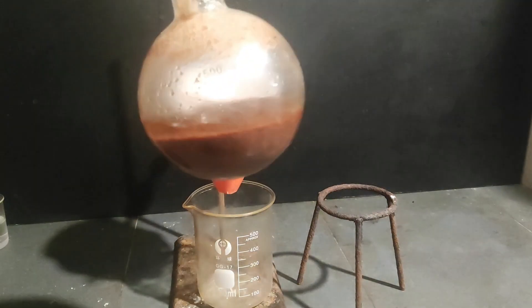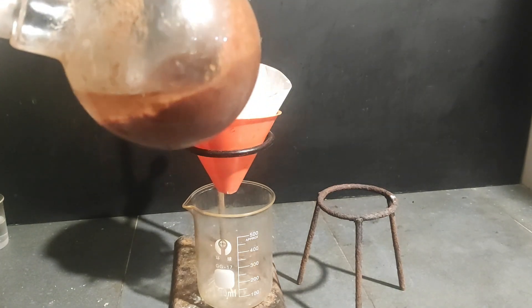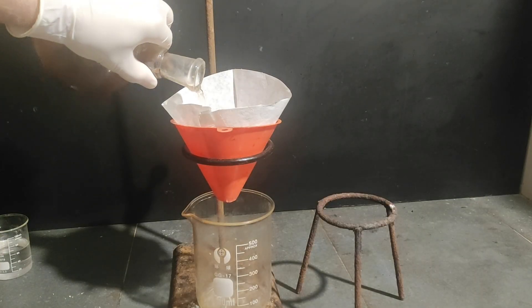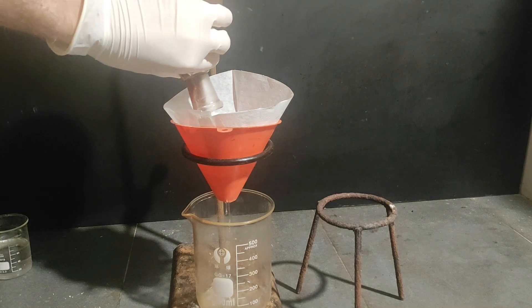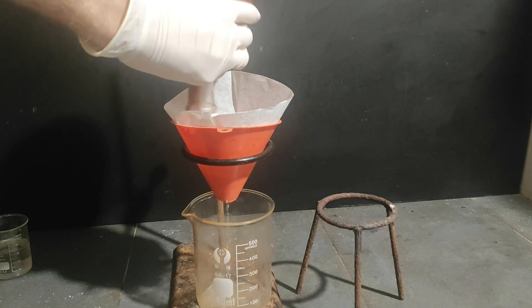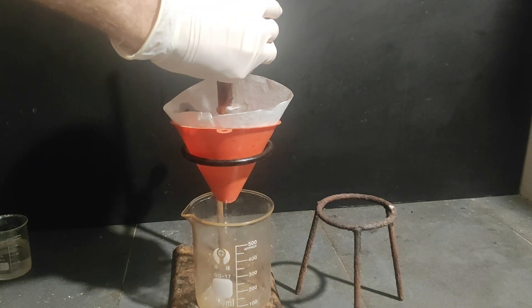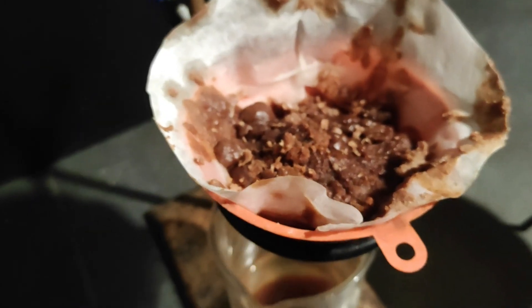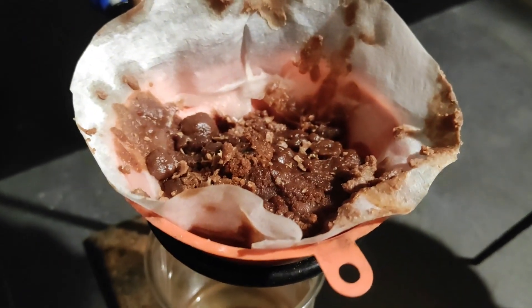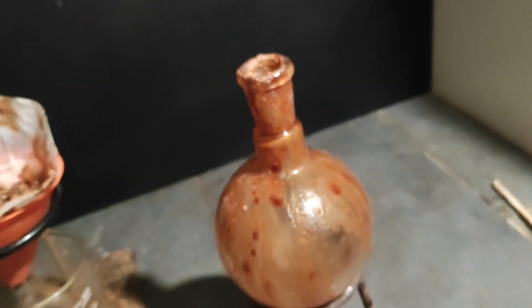I let the flask cool down, and as you can see it has become quite a mush — not exactly solid, but not liquid either — so we're just going to filter this. I filtered what looked like some light tar, which was very weird because it un-tarred itself over time by some random magic. That was very surprising, because most of the time tar just makes more tar and doesn't make cool crystals. In the end, the filtration was not going so well, but we have quite a bit of product to crystallize, so I decided to remove the filter paper that was decomposing and put everything together.